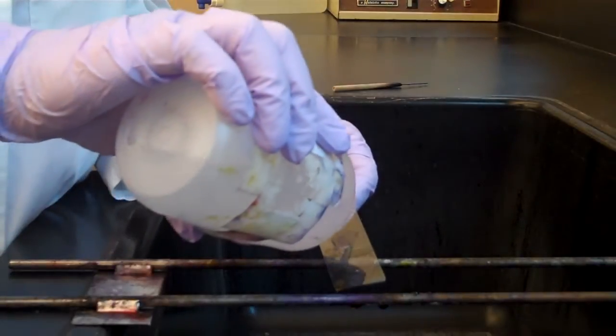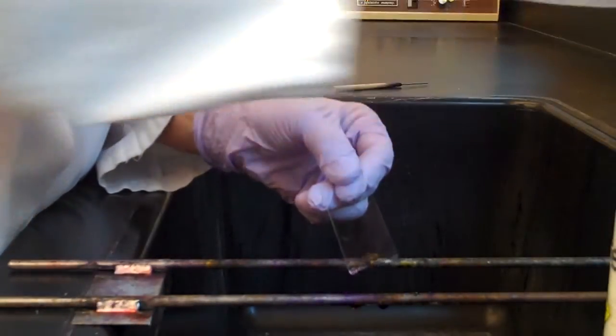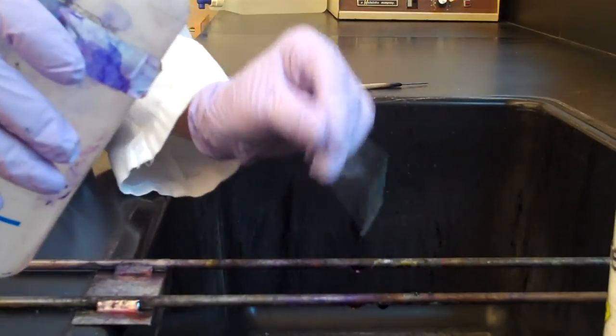Squirt decolorizer on the slide and as soon as you see the color lift, you're going to rinse the slide with deionized water and shake excess water from the slide.